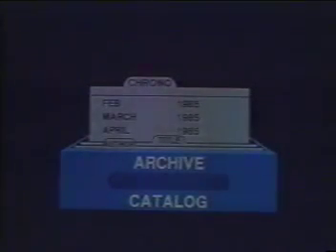The indices in the archive drawer are organized like a card catalog in a library. We will demonstrate the use of the author index to find and retrieve an experiment that was archived by Dr. Thomas Kipps. First, we must flag the drawer for retrieval.